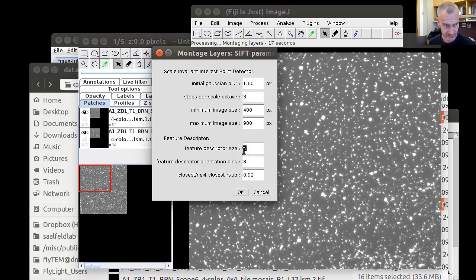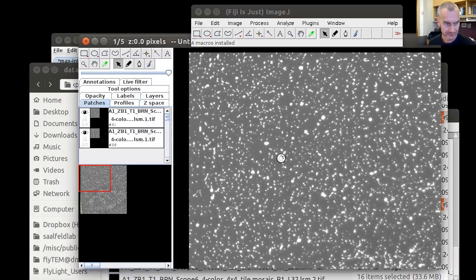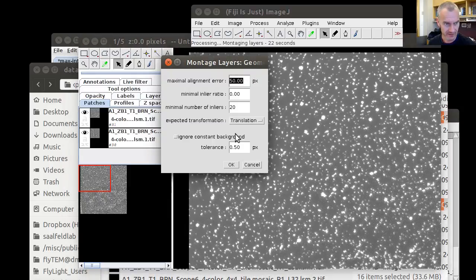We reduce the feature descriptor size here to 4, because we know that the images look very similar, so there's not much of a difference expected. We allow a maximal alignment error of 50 pixels. It's probably less, but this is only an upper bound. And we require for each overlapping candidate that at least 20 corresponding points are identified that support a translation. We can check or not check this box. It doesn't make a difference here because we know that none of these images has been imaged twice.